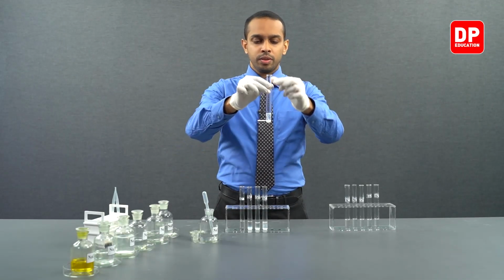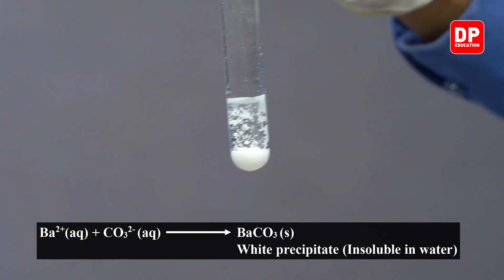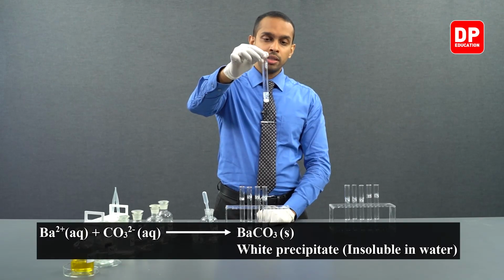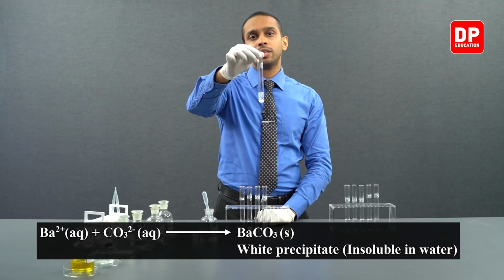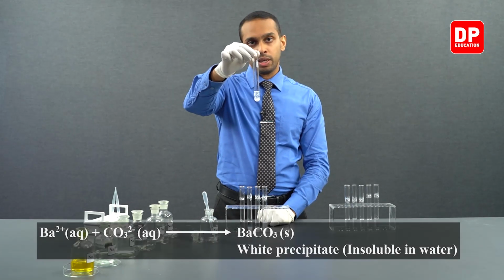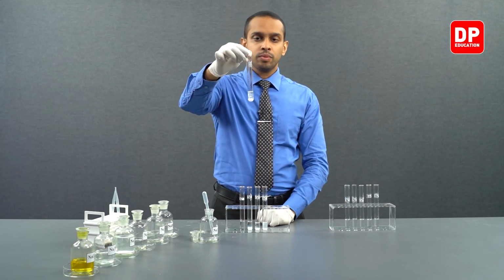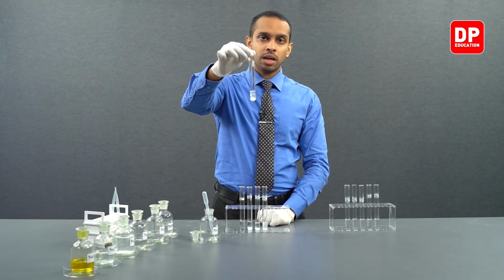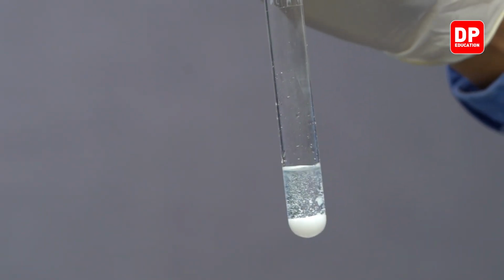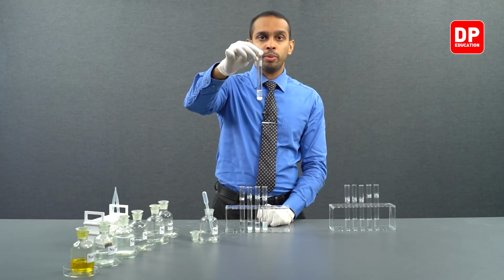As you can see, just like in the previous 3 experiments, when I added carbonate ions into barium 2 plus aqueous ion solution, we formed a white color precipitate. This is due to the formation of barium carbonate. Barium 2 plus comes into contact with carbonate ions and forms barium carbonate, which is a white color precipitate, and this barium carbonate is insoluble in water.